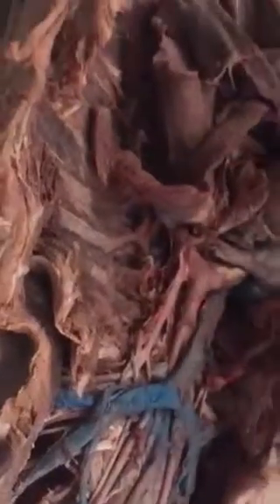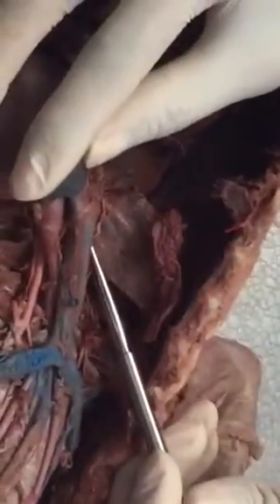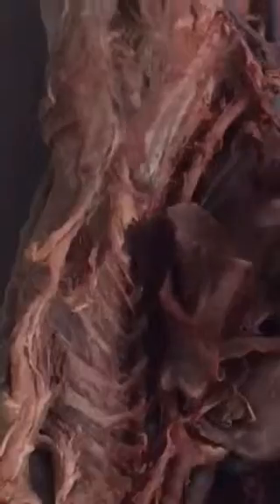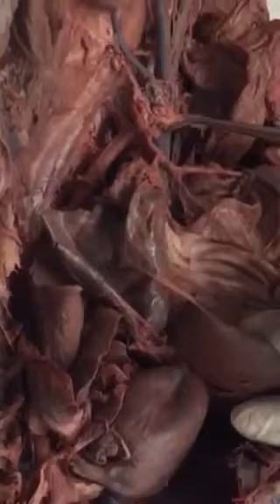Below it would be the inferior, everything down here would be the inferior vena cava, and that also leads into your right atrium. This actually right here is your azygos vein, but again, you don't need to know that. And these, oh, that's for arteries, never mind. So following all down here, clear some of this out so you can see some of it. Here's your inferior vena cava, leading the whole way down here, inferior vena cava.